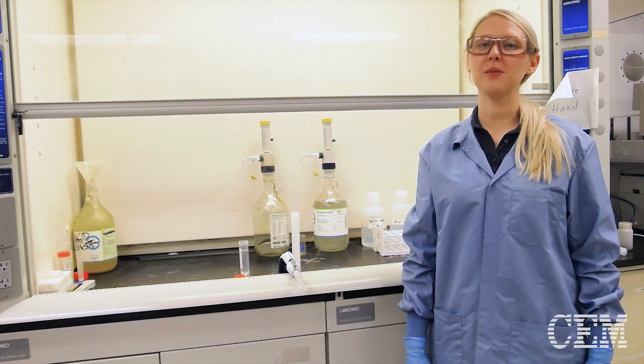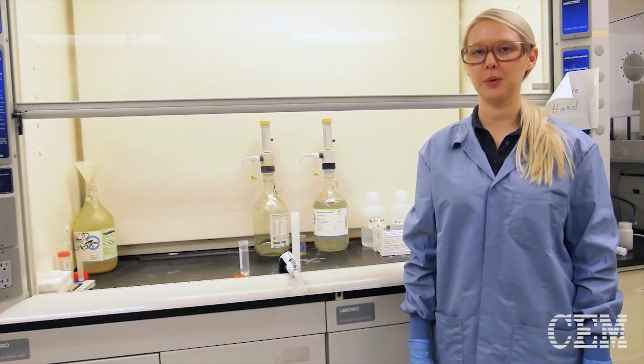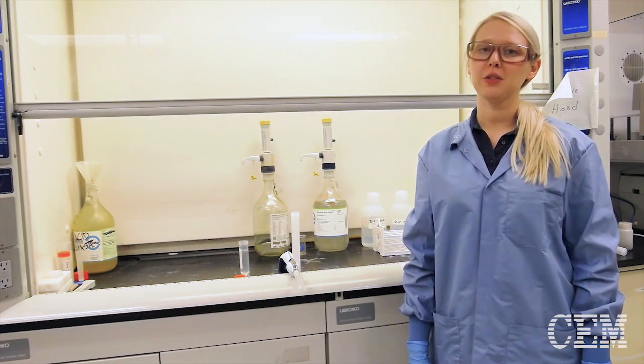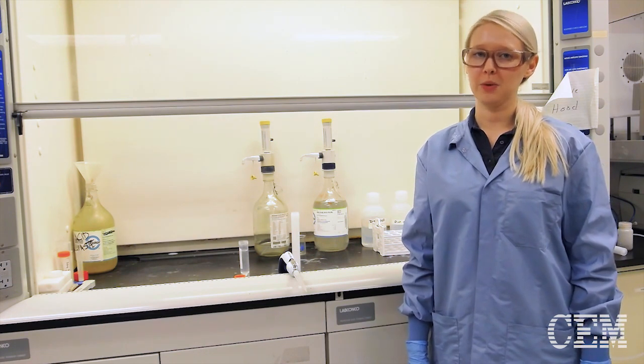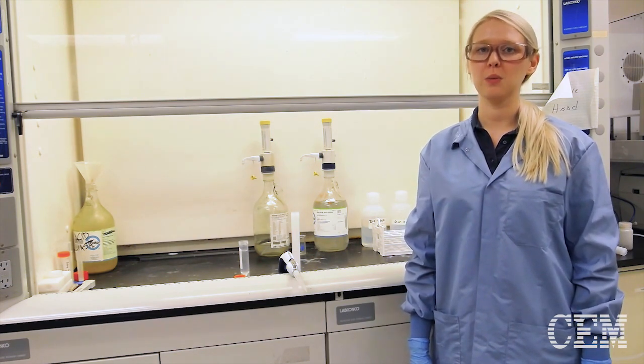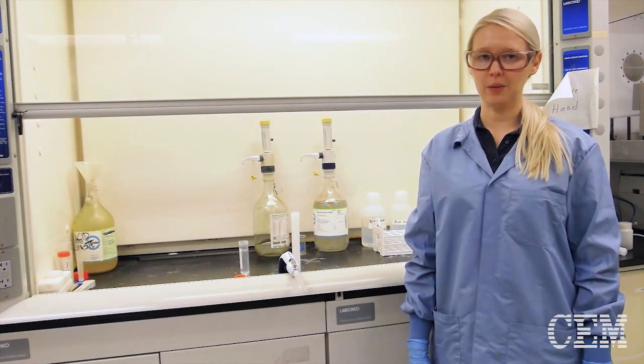Hi, my name is Macy Harris and I'm with CEM analytical application group. Today I'm going to show you how to rinse down residual sample to the bottom of your vessel by adding acid onto the sidewalls.